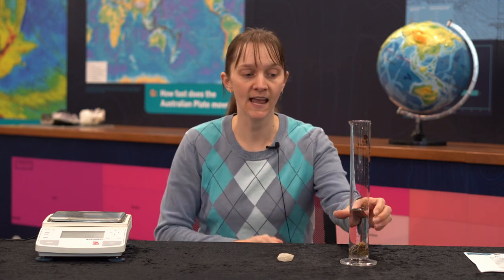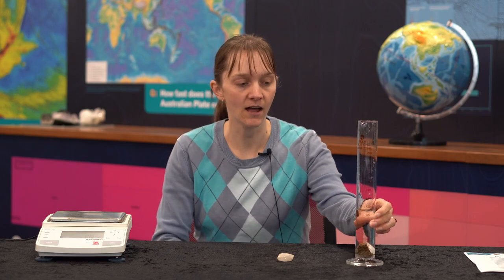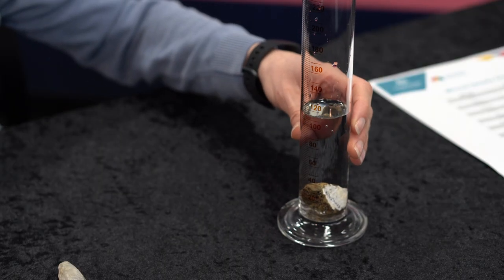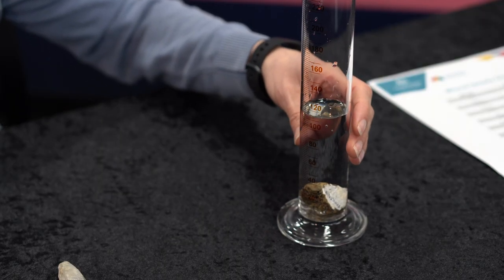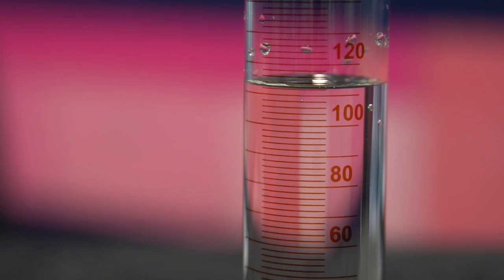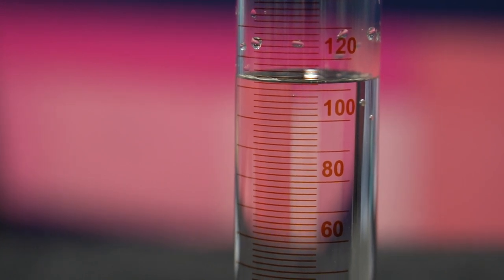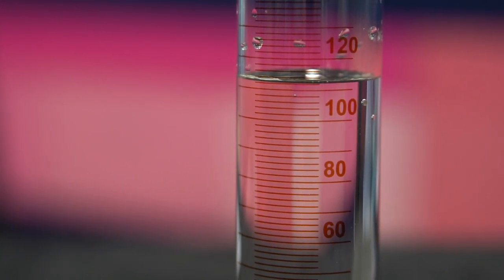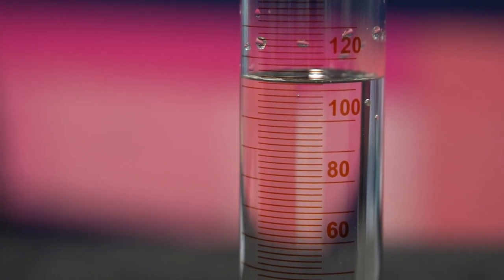You need to get down to eye level to ensure that you're getting an accurate reading. In this case, the new water level is 113 millilitres.